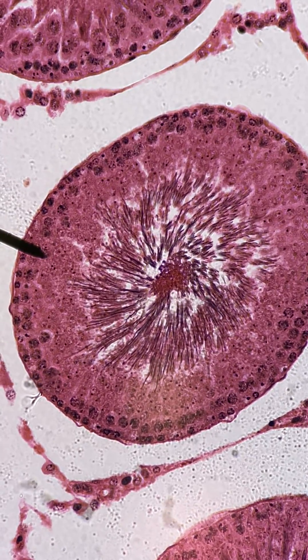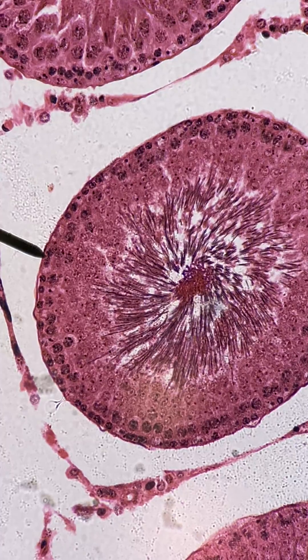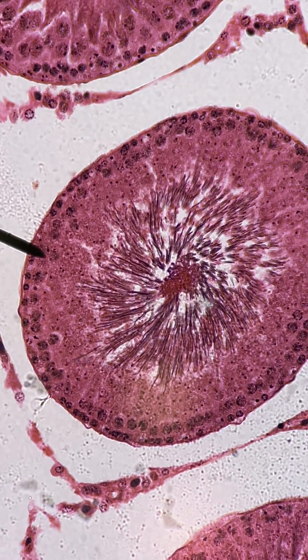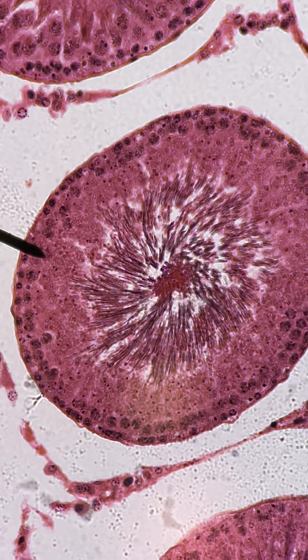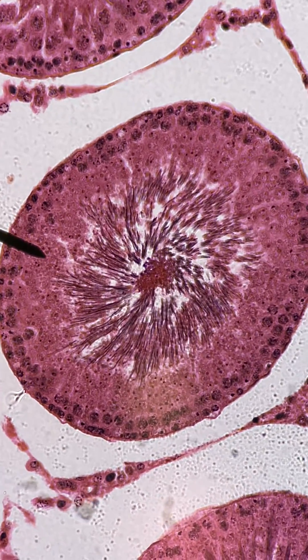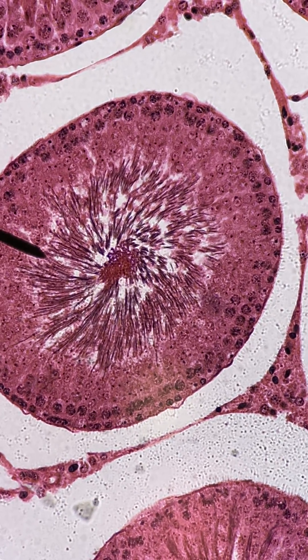The cells start out here — you're not going to have to identify each one — but basically from the outside going in is how meiosis occurs. Meiosis starts out here in cells called primary spermatocytes. As they divide, they become secondary spermatocytes, and then they ultimately become spermatids or spermatozoa once they fully mature.